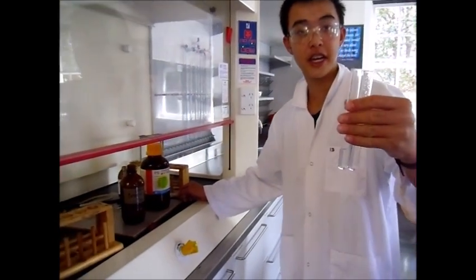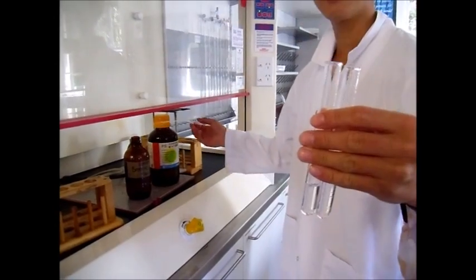However, how will I be able to know which one is which? Well, I've been told that adding bromine water and shaking vigorously may solve the mystery.